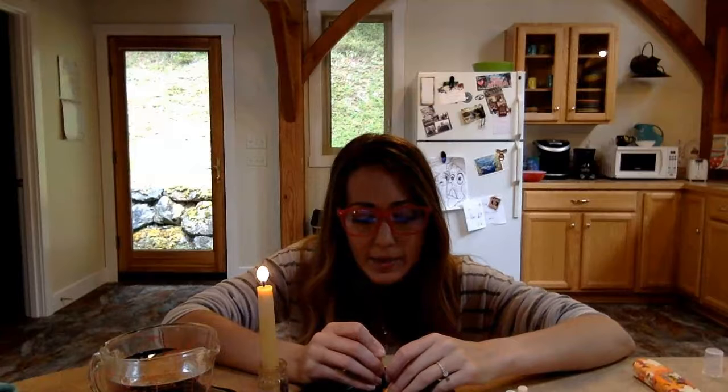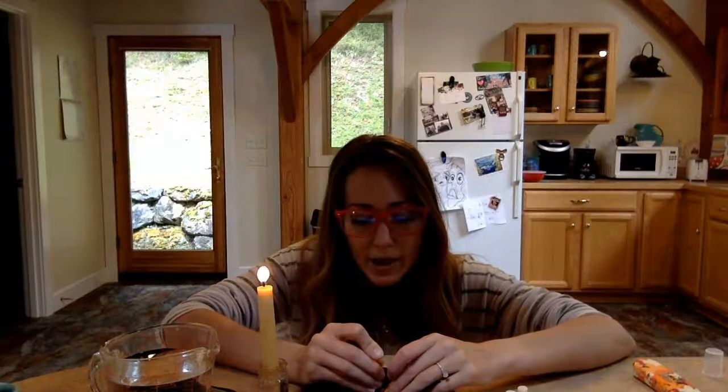Okay, last but not least for my items, I've got my peanut here. Now I don't really know how this is gonna burn because it's got Cajun seasoning on it from my trail mix. So it might take a little bit longer to set. Okay, so I'm gonna reset my stopwatch. Hold it over here. Oh man, it's letting off a lot of black smoke. Cajuns. Oh, okay, there we go. Start my stopwatch. We'll see.